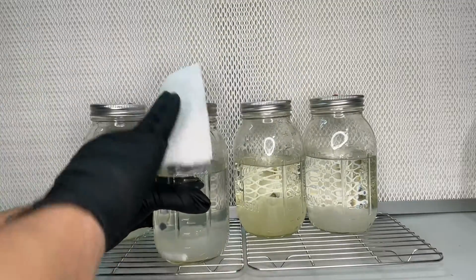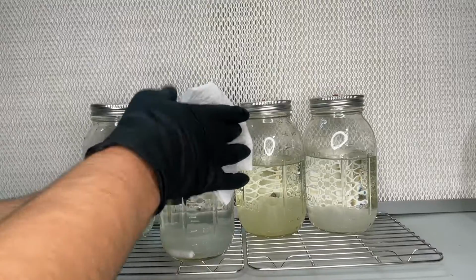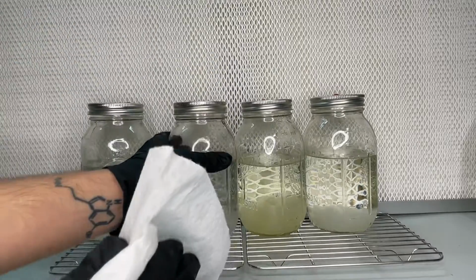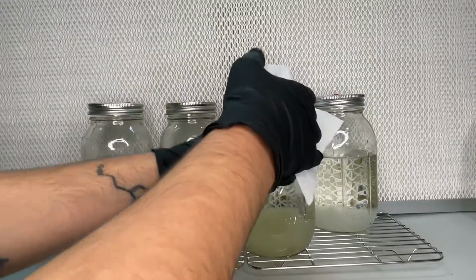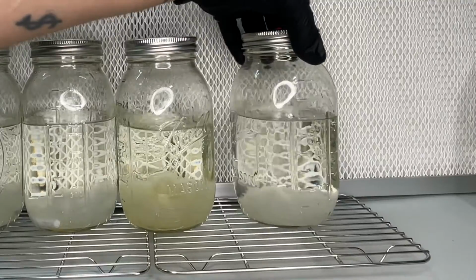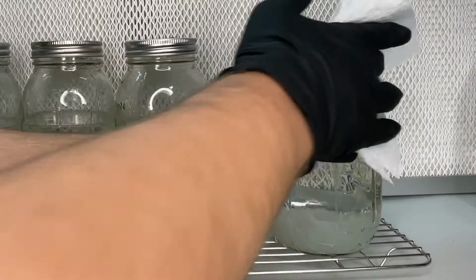These four jars of liquid culture are all the same species of mushroom. They were all made using light corn syrup, and it must not have been enough nutrients because the mycelium didn't even grow past the halfway mark. And it's been about 5 months.